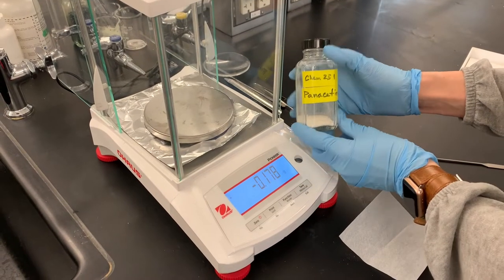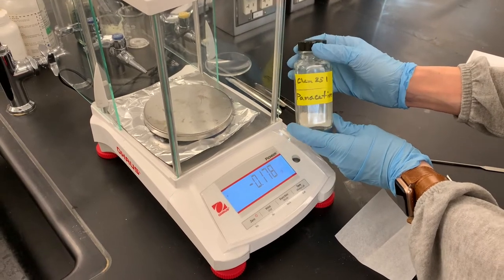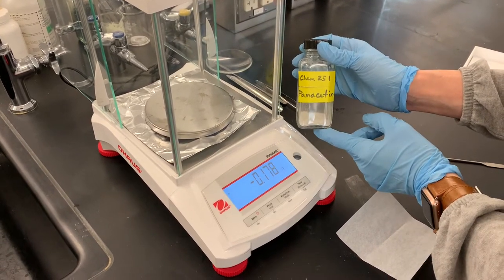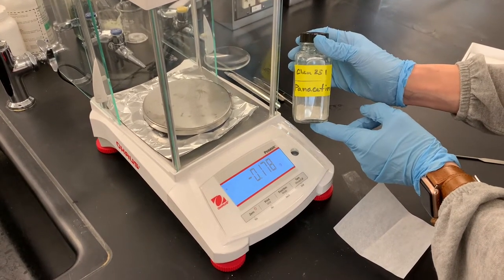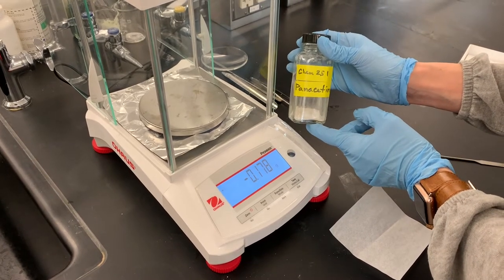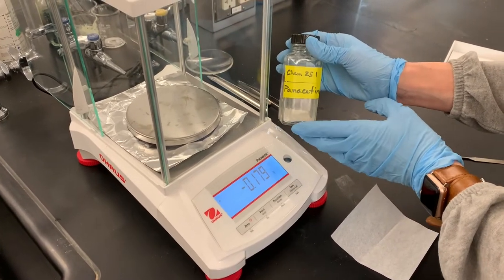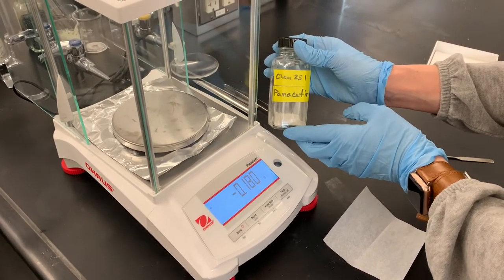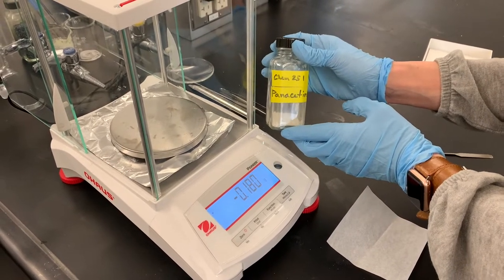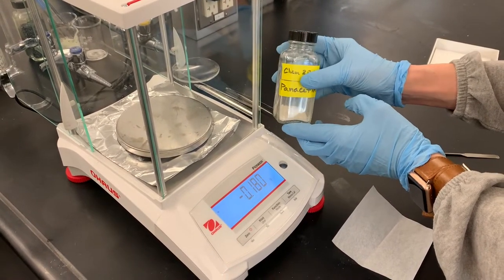For this experiment, we have a mixture called panacetin. This is a mixture of sucrose, aspirin, and then a third unknown chemical. In this experiment, we're going to separate all three of those components from each other, and we're also going to identify the unknown substance that's mixed in here.